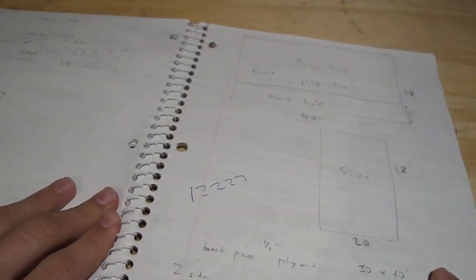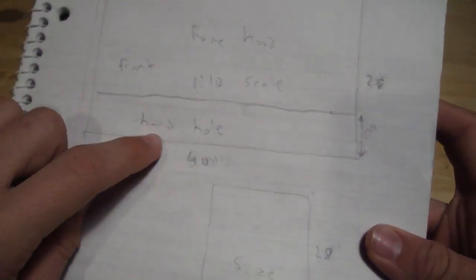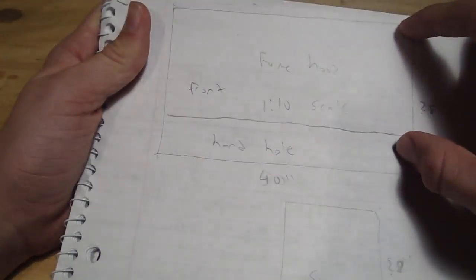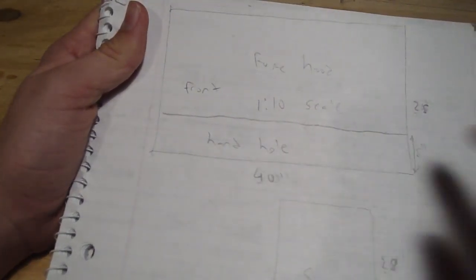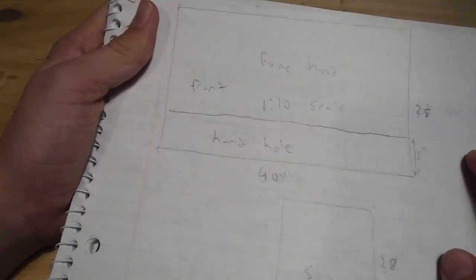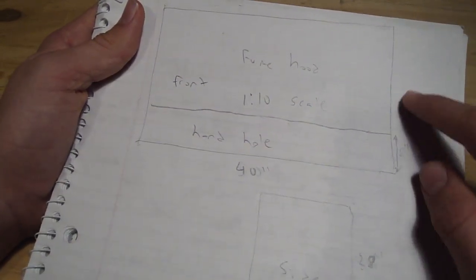I've been planning out a design for a little while and here's my design. It's not drawn to scale — I had it drawn to scale but then I made some adjustments and never re-scaled it, but I still have the measurements. First of all, the front is going to have some plexiglass that comes down and it has a little opening for your hands. You can see through it, and the front is going to be 28 inches tall.